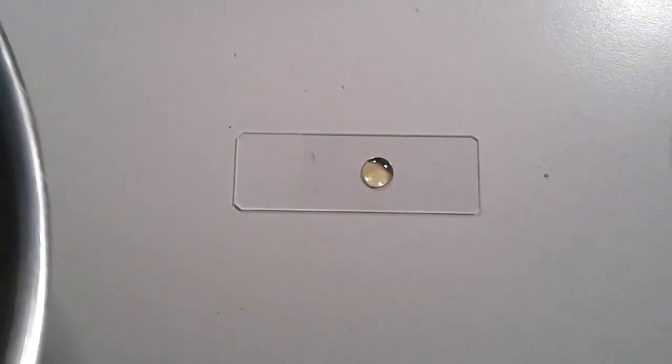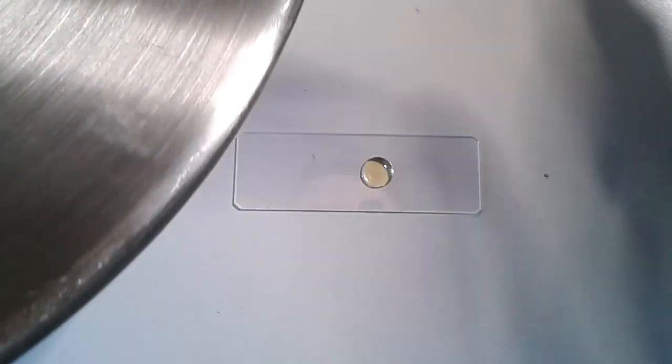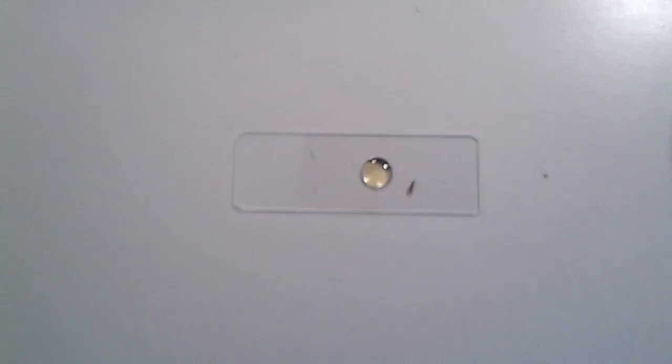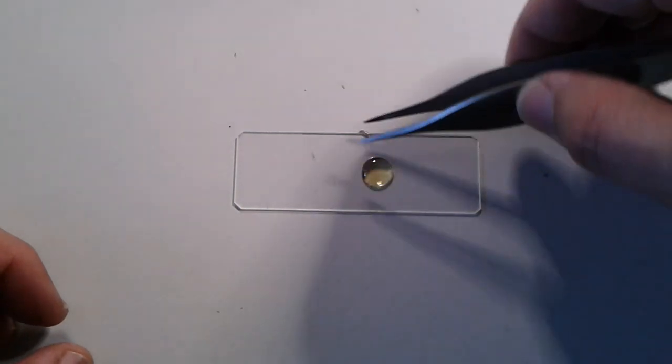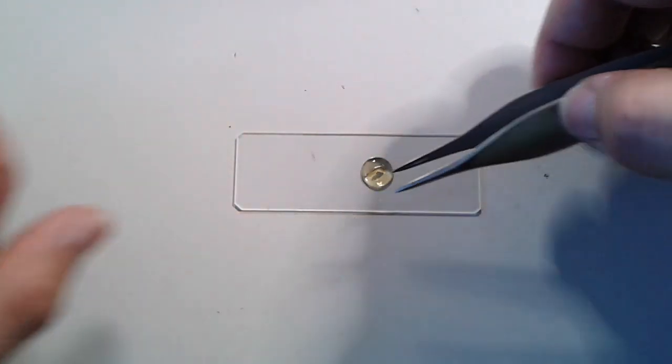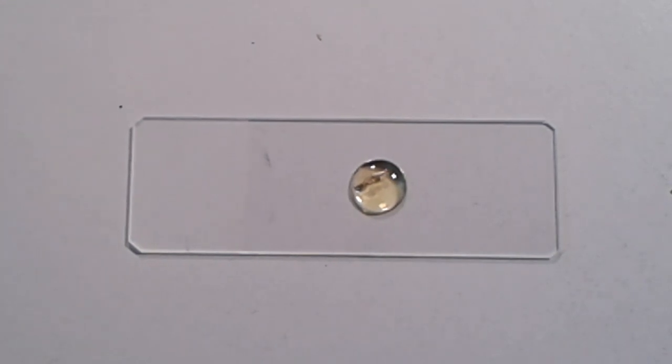The big problem was how do you actually get the silverfish mounted. I tried to get it out of the pot and it fell right on the slide, and then I had to help a little bit. I know it was not a very nice way of killing it, but I think it was a quick death — the solvents of the mounting medium killed it quite quickly.